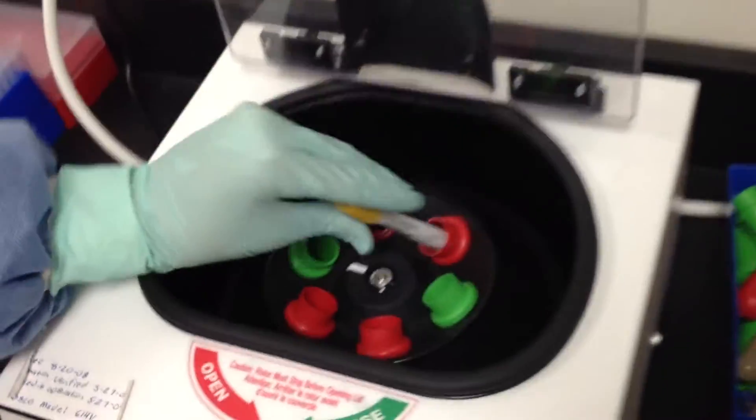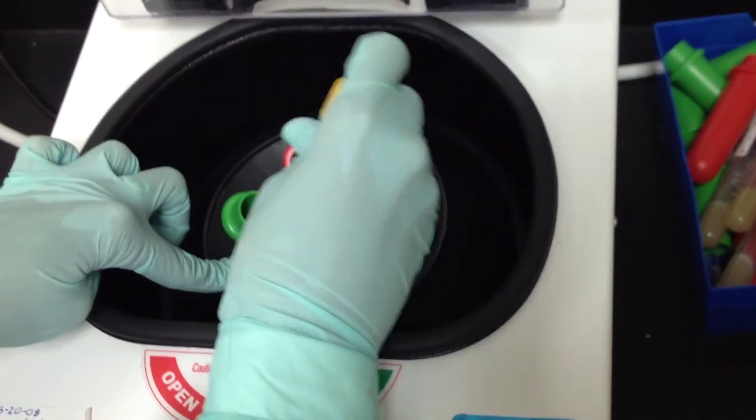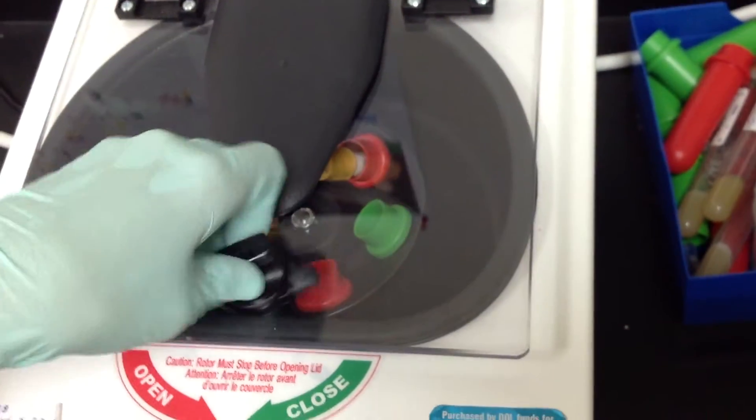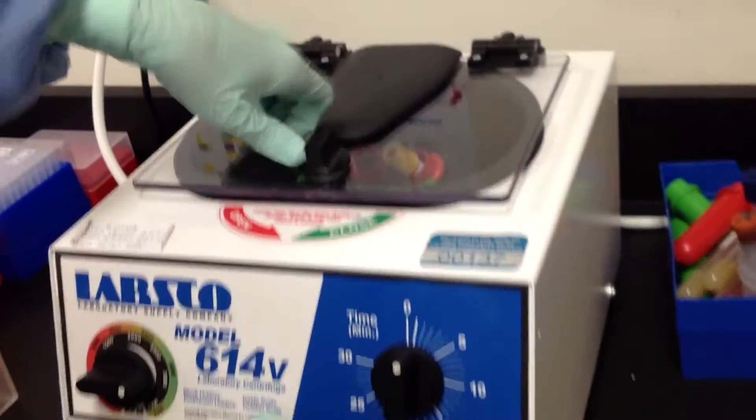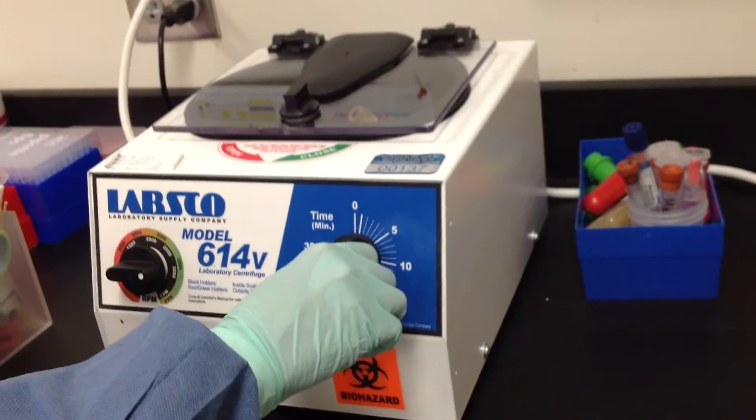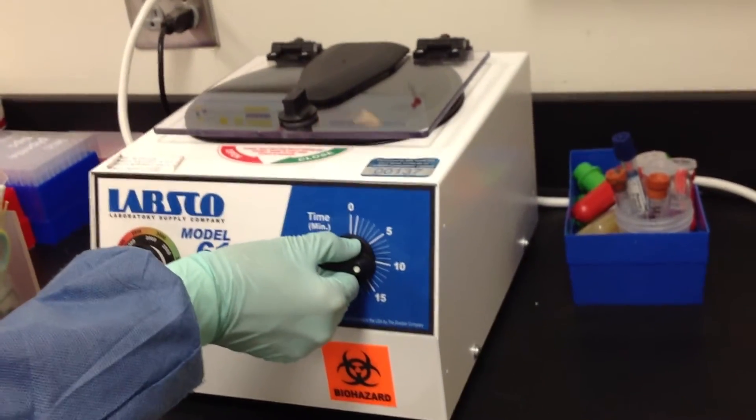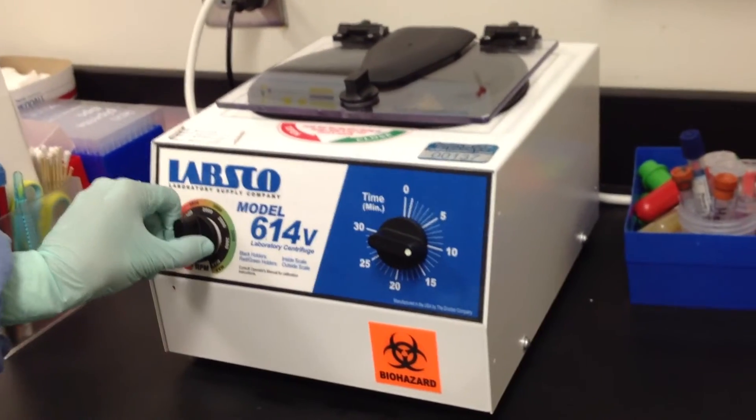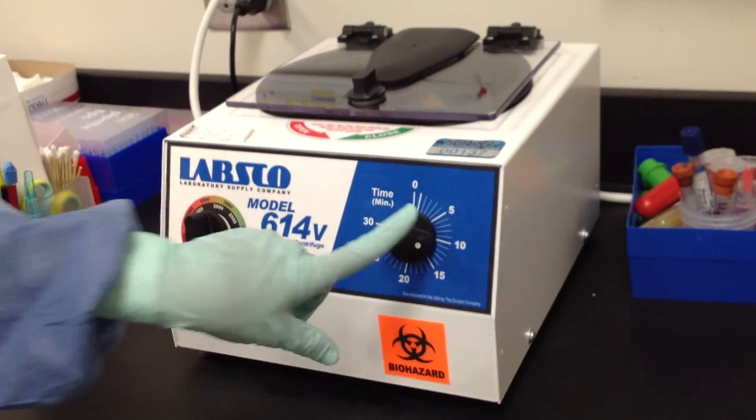You then go place them across the center from each other, lock it to close it, and spin for 10 minutes at full speed.